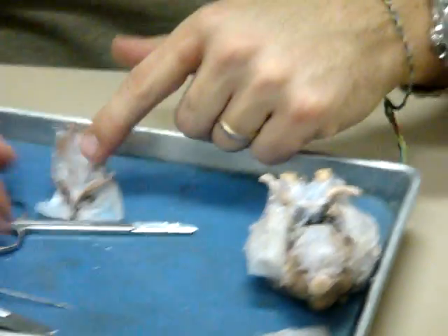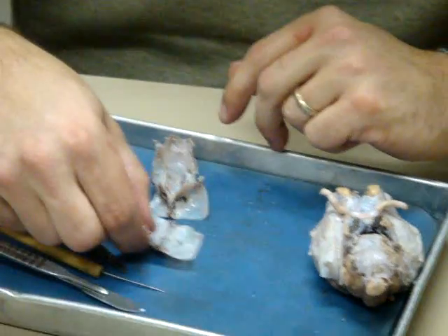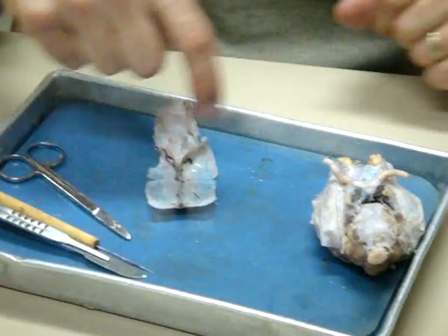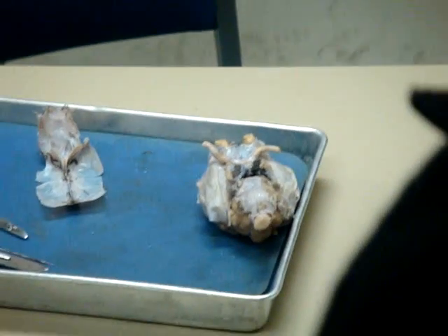This, if I look at it this way, this was where the cerebellum would be, right? This is where the two cerebral hemispheres would be. This would be the continuation of that, okay? So the two cerebral hemispheres are here, and then, hang on, I just want to rinse my finger off, it's burning. Maybe I should put a glove on that hand.